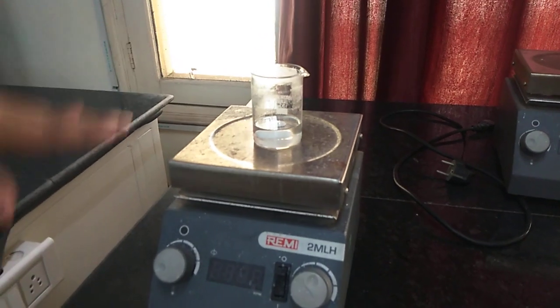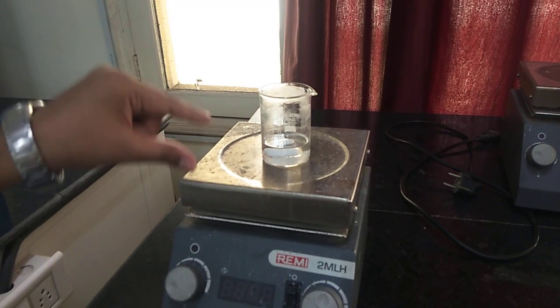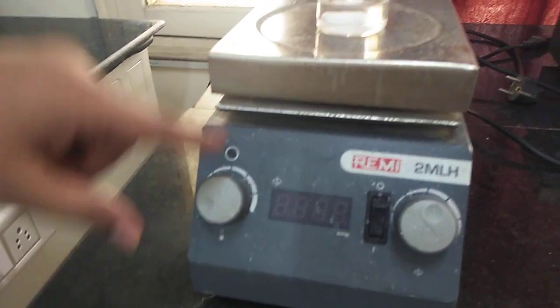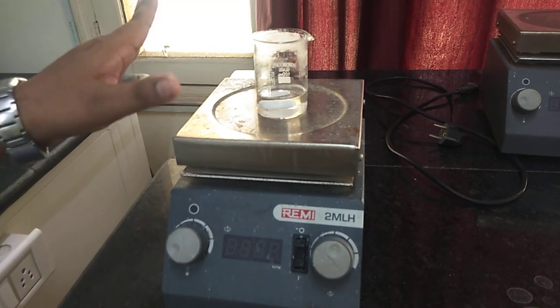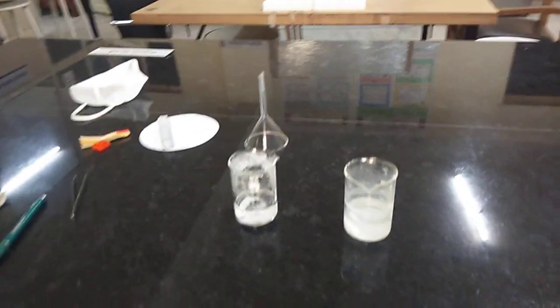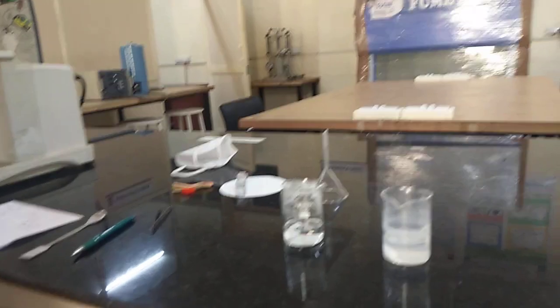Similarly, the sodium hydroxide solution has been prepared using this hot plate and magnetic stirrer. The hot plate can reach up to 250 degrees Celsius, but for simplicity we prepared both solutions at room temperature — just maintain RPM at 1100 to 1200 and stir for two to three hours until the precursor completely dissolves. Here we have the zinc acetate solution and the sodium hydroxide solution ready.